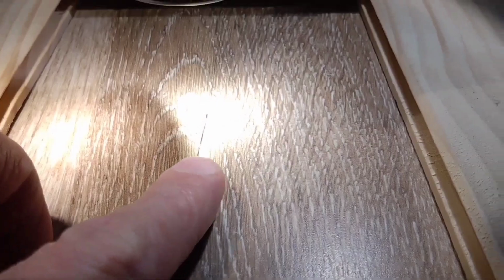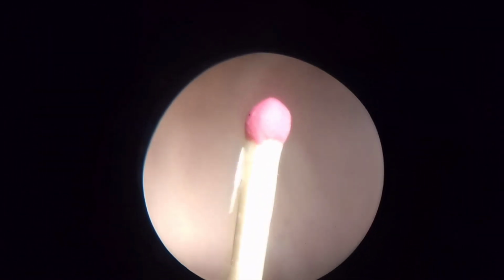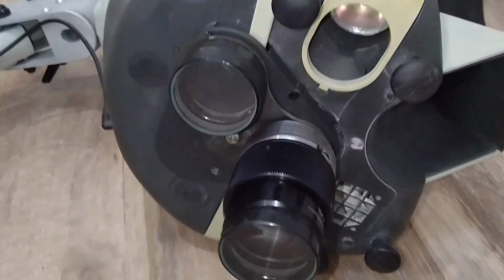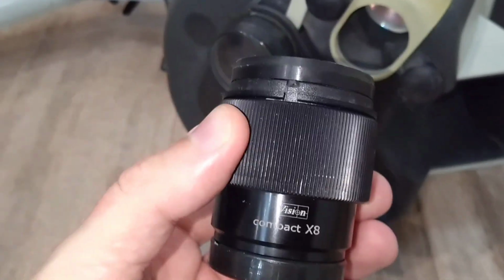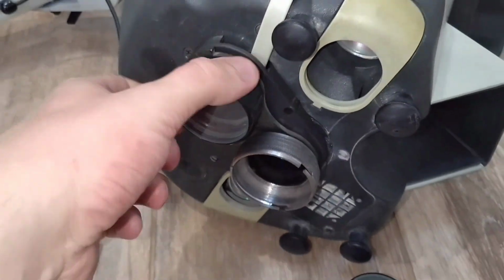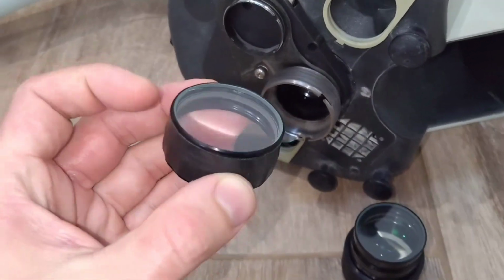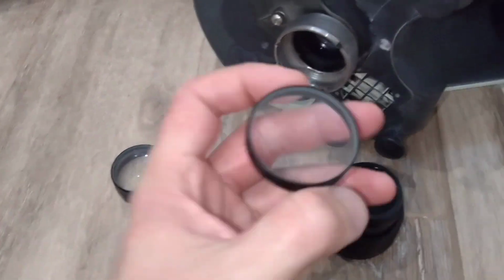These microscopes started being produced around the 2000s, and currently, in used condition, they can cost between $600 and $800. Its main advantage, in my opinion, is the clear three-dimensional image with a wide field of view. Going ahead, I can say that it is quite simple to repair and maintain. Perhaps once every few years, or maybe once a year, it needs to be disassembled and blown out with air.